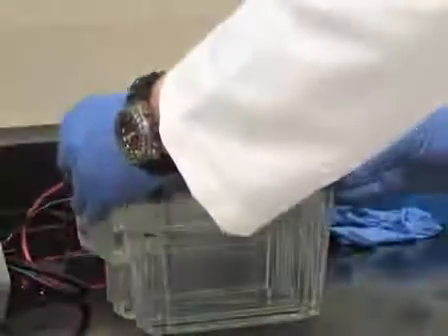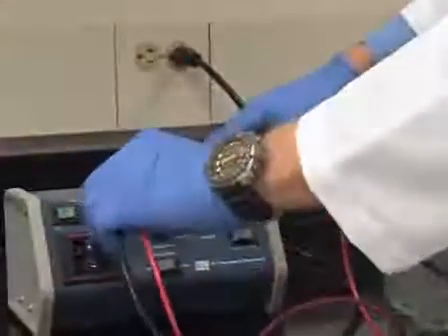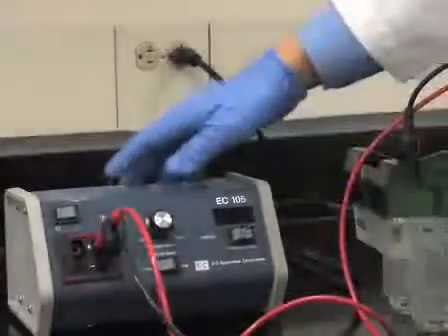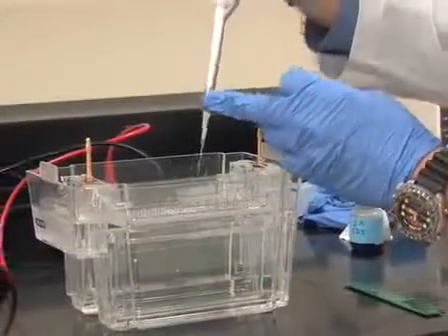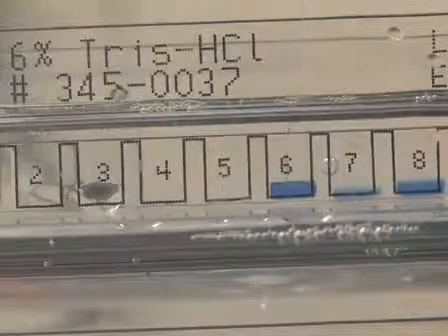Before starting the immunoblotting procedure, the protein samples must first be separated by electrophoresis using small or standard-sized one- or two-dimensional gels. Prepare the antigenic samples and load them into the lanes on the gel. Include pre-stained or biotinylated protein molecular weight standards in one or more of the gel lanes. These protein markers will transfer to the membrane and conveniently indicate membrane orientation and sizes of proteins after immunostaining.